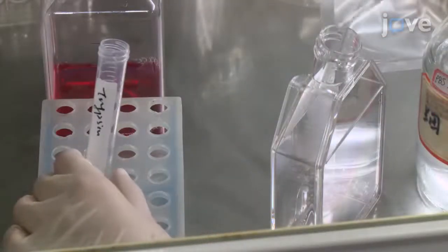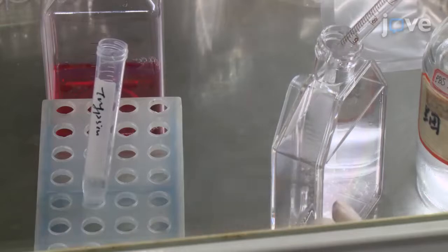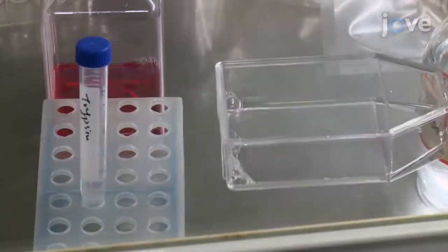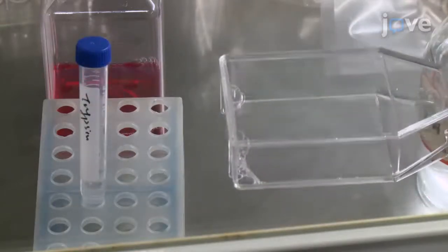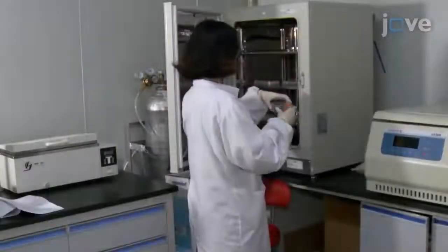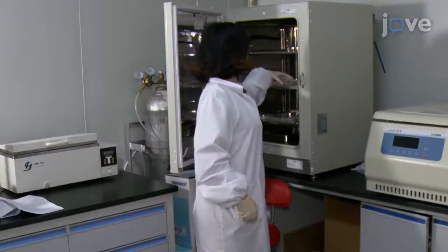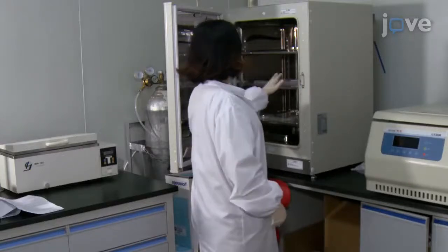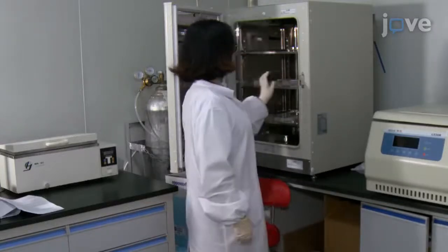Add 1.5 mL of trypsin EDTA and gently rock the flask. Then place it in the 37 degrees Celsius incubator for 20 minutes without rocking.